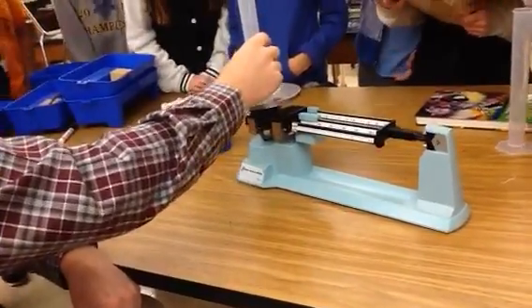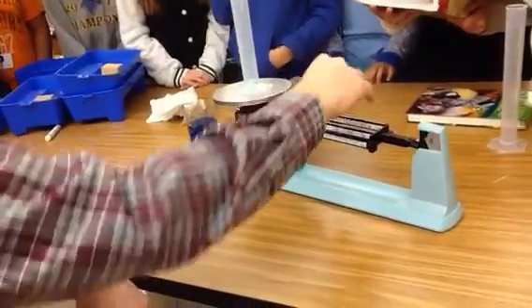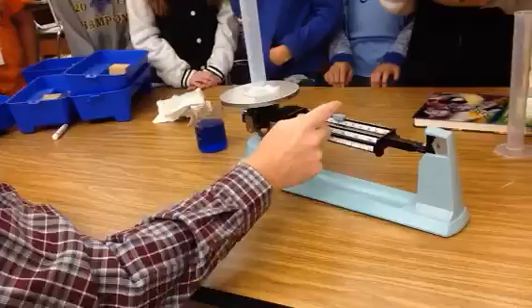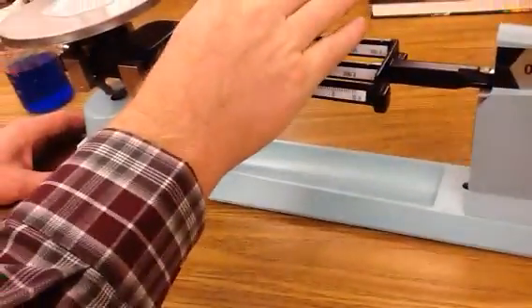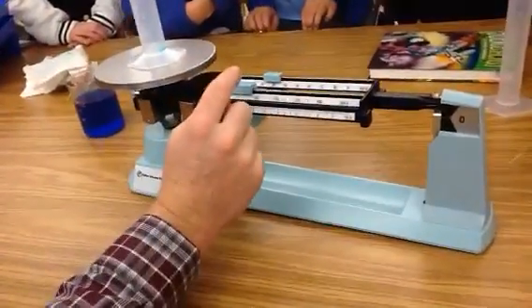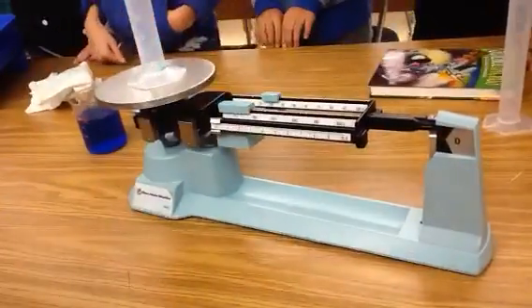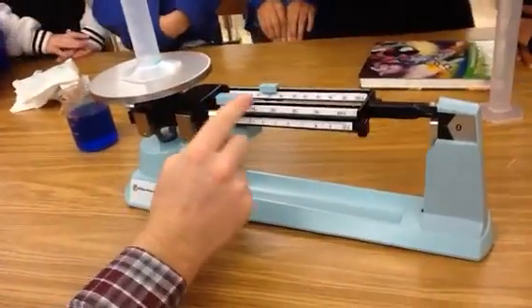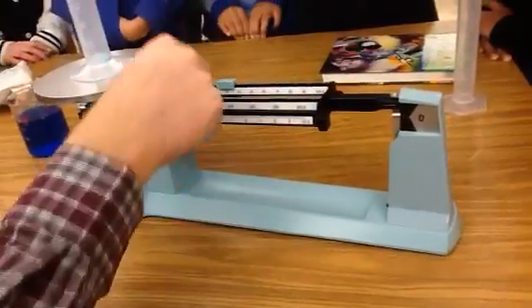So here we go. We're going to put this on the scale. We're going to go to about 40 — it goes down, so we go back one. Now we're at 30. That tells us it's between 30 and 40. We didn't do hundreds because I already knew — when you go to 100 it goes down, so that's why I went to the tens.